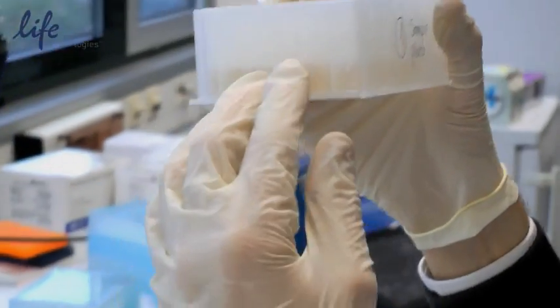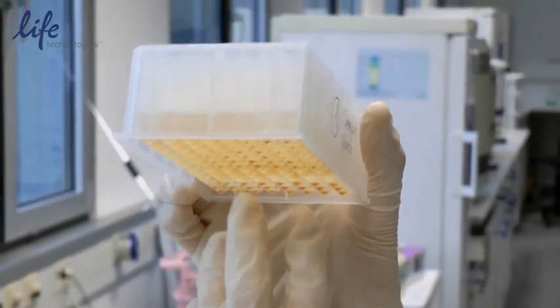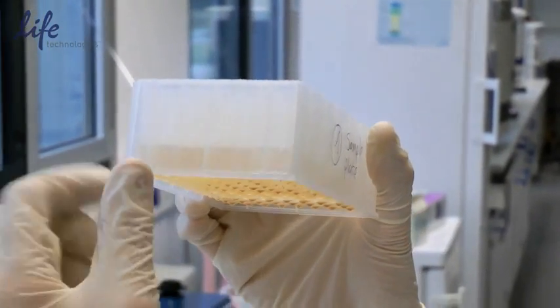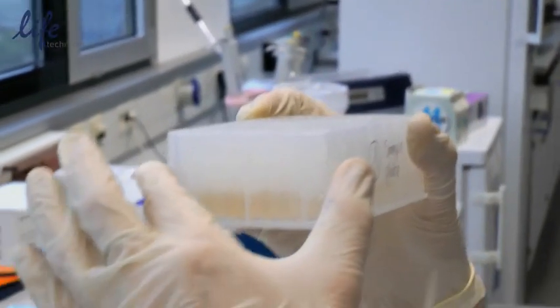Now that we've pipetted all of our samples, we can already see the beads in the bottom of the tubes. Everything is ready. We just need to add our sample and do the extraction on the instrument.